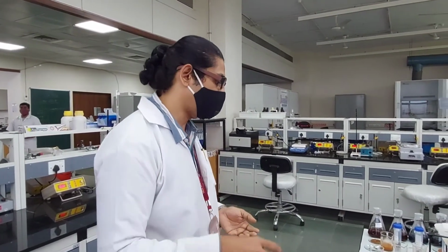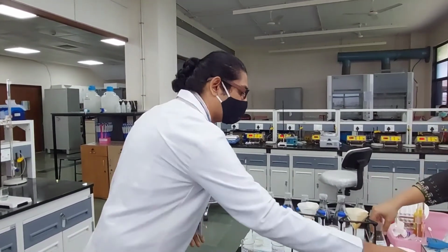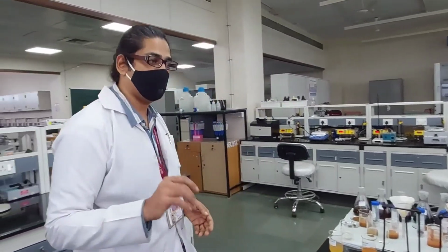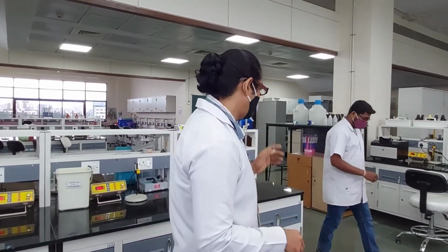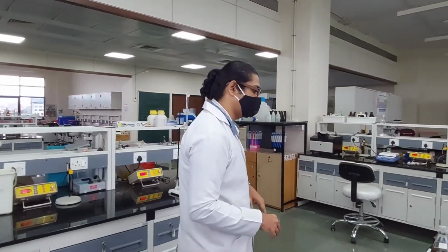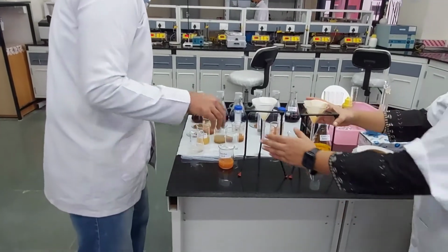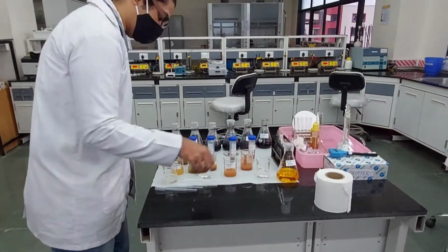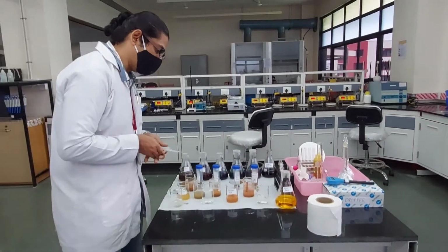Of course, one can argue there are sulfur contents and so on which might have gone, but they are in minuscule amounts, so it doesn't make too much of a difference. Mostly it's the moisture that is being lost. Now the last part we are going to do is a bit lengthy, and Mayuresh is going to help us. Meanwhile, we are just going to make some space for him to do it.